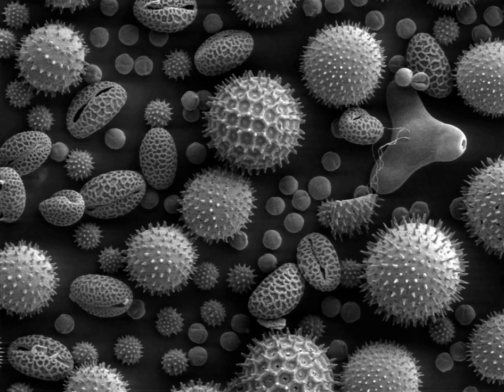Due to the very narrow electron beam, SEM micrographs have a large depth of field yielding a characteristic three-dimensional appearance useful for understanding the surface structure of a sample. This is exemplified by the micrograph of pollen shown above. A wide range of magnifications is possible, from about 10 times — roughly equivalent to that of a powerful hand lens — to more than 500,000 times, about 250 times the magnification limit of the best light microscopes.